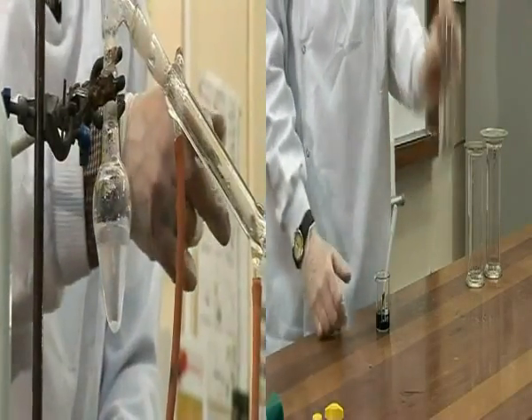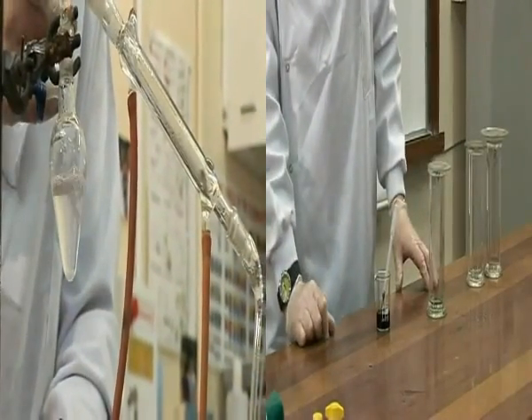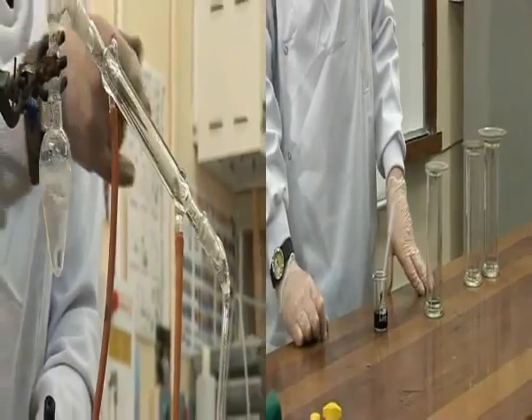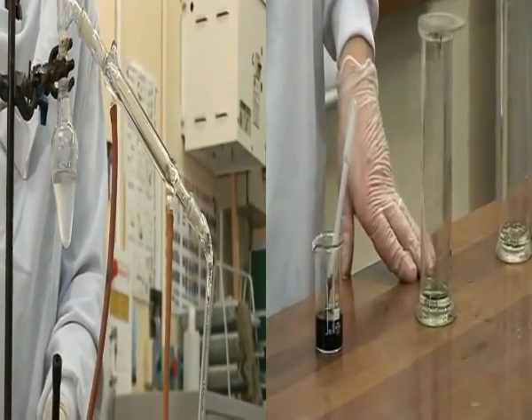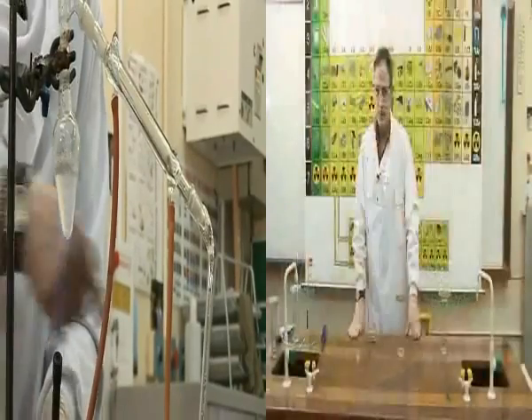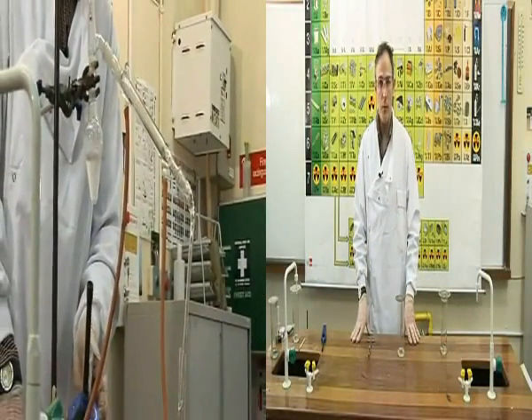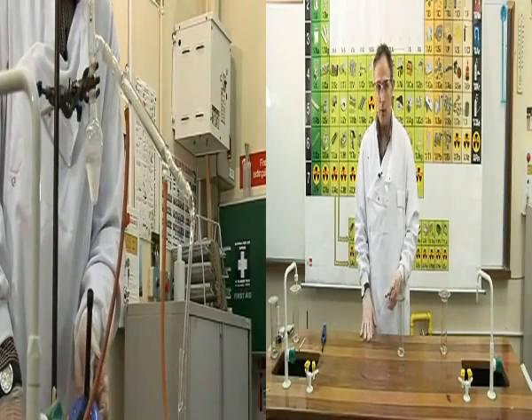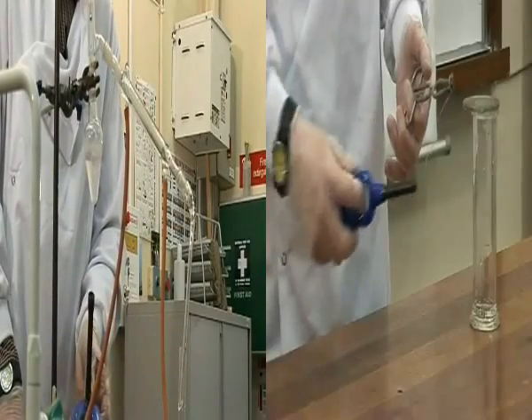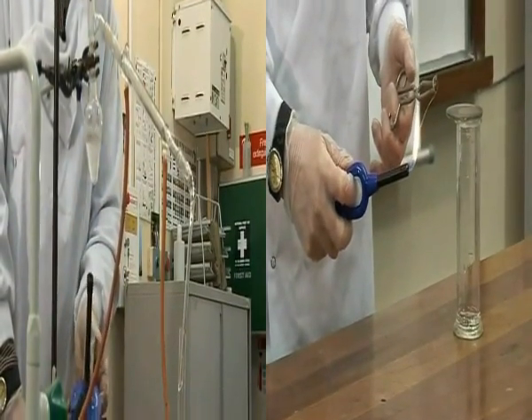A liquid can be seen forming in the condenser now, and that liquid is the alcohol vapor which has travelled down into the cold condenser, where it has condensed back into alcohol liquid. The liquid is forming in the graduated cylinder, and our separation is going nicely. Again, the condensation can be visibly seen in the condenser.